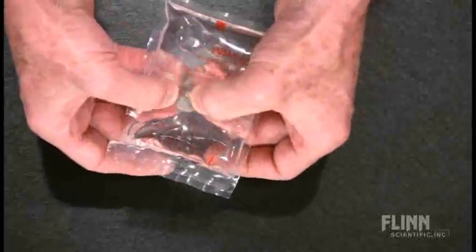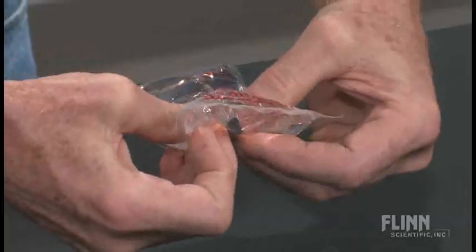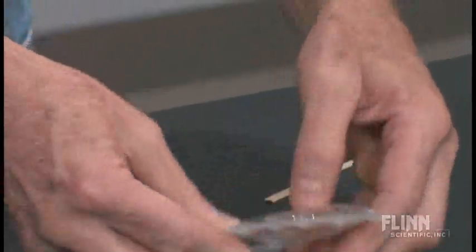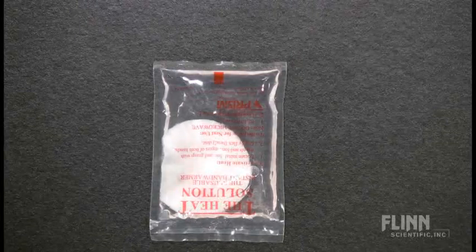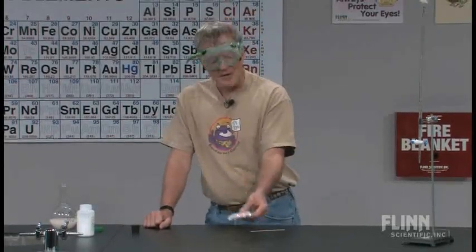This thing when it's bent — I'm going to reach in here and give it a bend — there we go. You can see that crystallization starting to take place, and this once again gets quite warm. You can recycle this — put it in some boiling water or hot water, let it go until it all goes back to a clear solution, and it's ready to go again. Do the same thing with this flask: stick it on a hot plate, heat it for a little while, it'll go back into solution, put the stopper on, and set it on the shelf until next year.